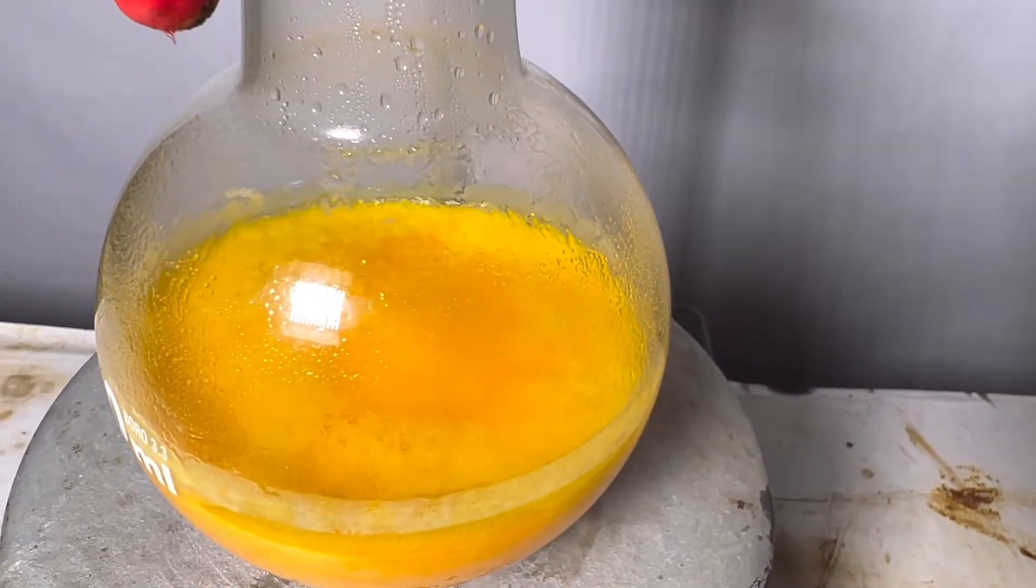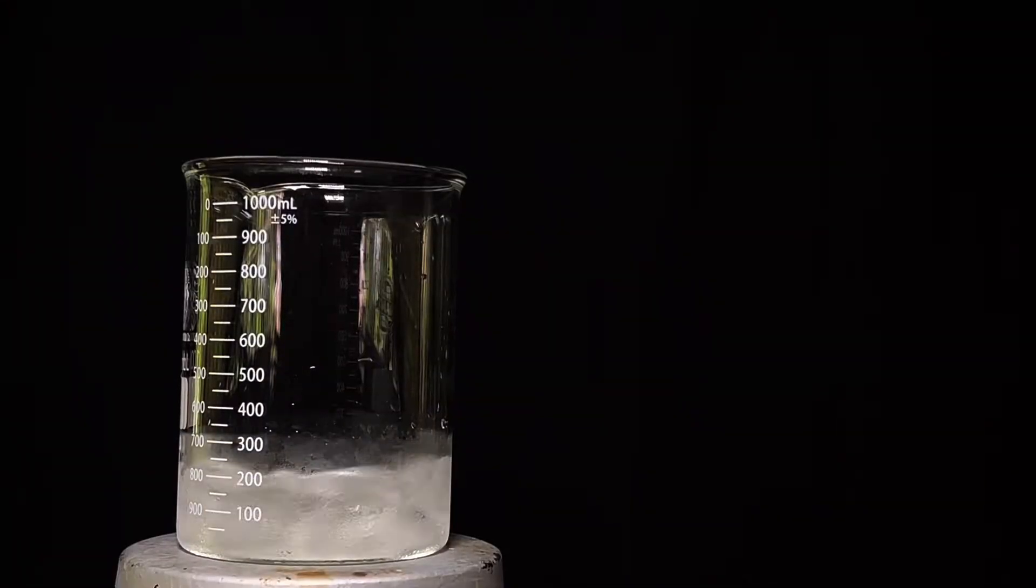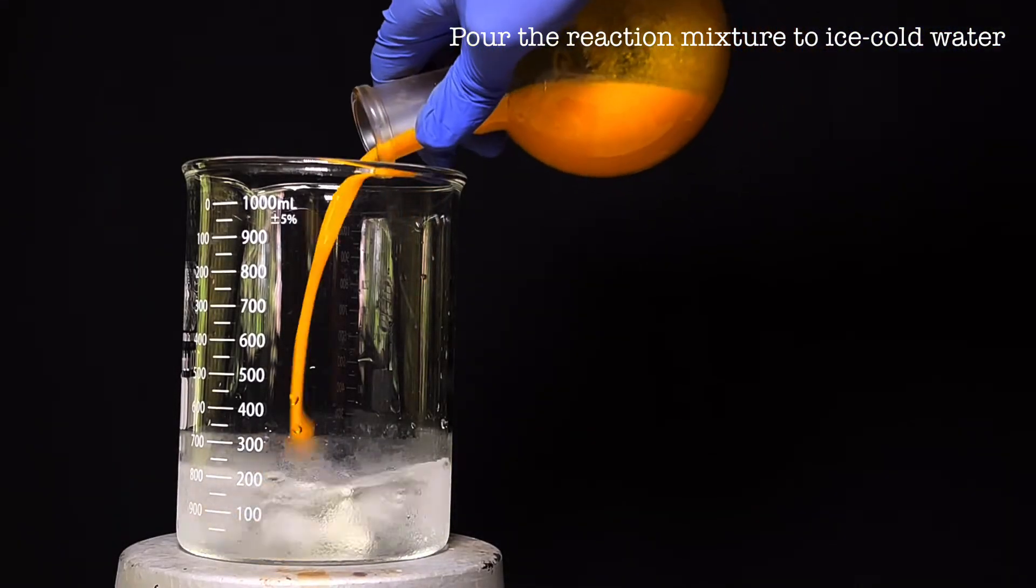After the reaction is complete, the flask was refluxed gently for 30 minutes and then allowed to cool to room temperature. Now the contents of the flask was poured into around 200 ml of ice water.